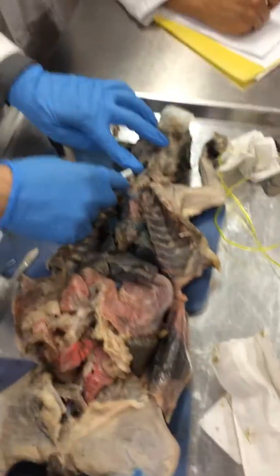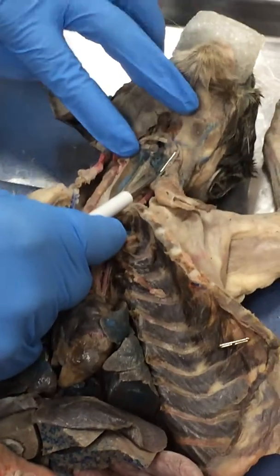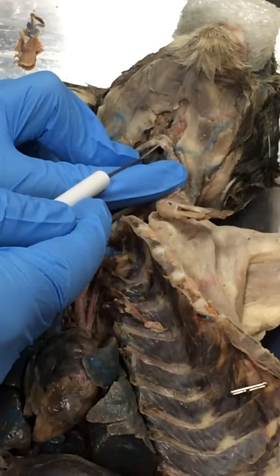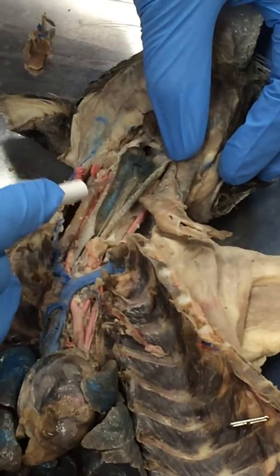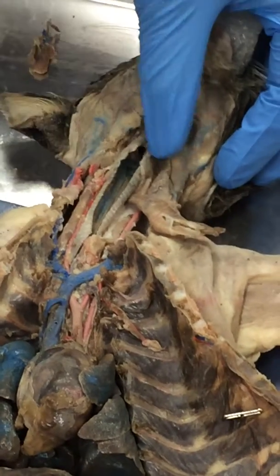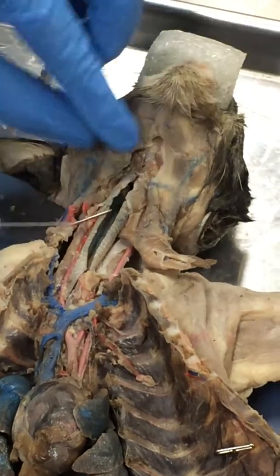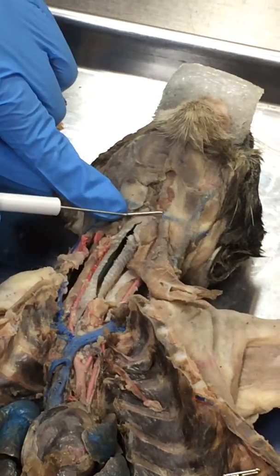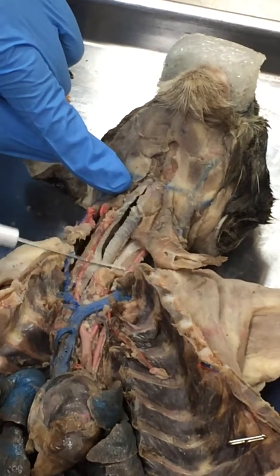You should have dissected the trachea and the larynx, and when you did that, you saw the epiglottis, which you can see right here, this elastic band up on top. Inside the larynx, you saw these folds. You see these folds? Okay, these are the true vocal cords. Now the epiglottis was elastic cartilage, and the thyroid cartilage, which is here, is hyaline, and so is the cricoid. There's the thyroid, and after this groove, you have the cricoid. Then you have the tracheal cartilages.